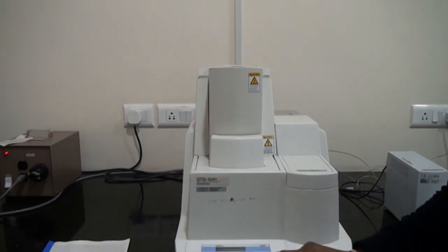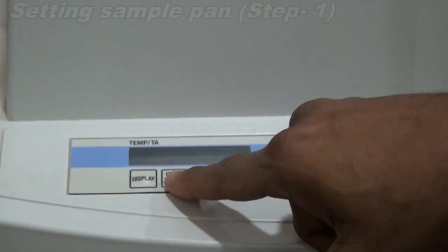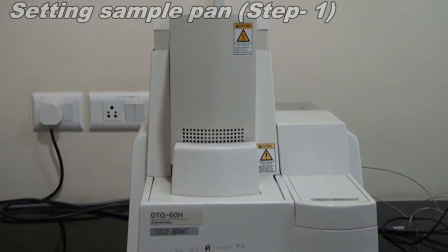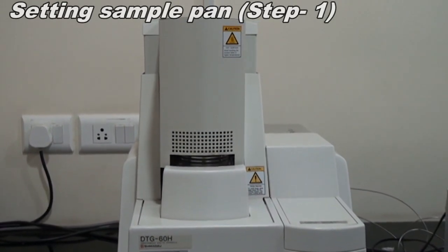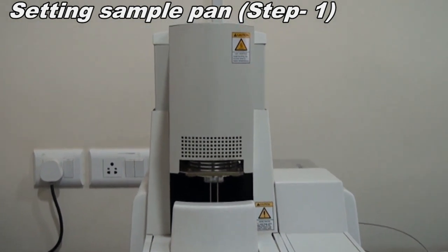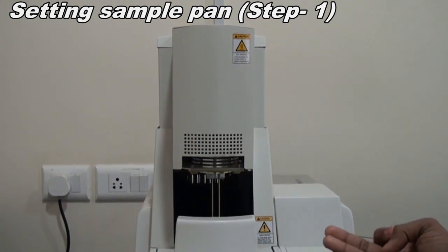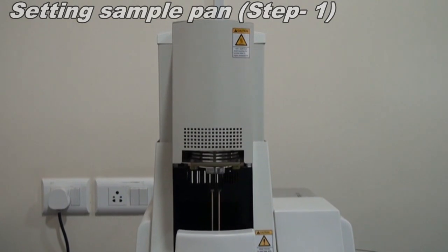Setting the sample pan. We need to first open the furnace by clicking the open and close button. The furnace will be opened. We need to wait till the furnace is completely open. As we know, the sample pan will be on the RH side and the reference pan on the LH side. You need to take out only the sample pan to measure the weight of the sample.